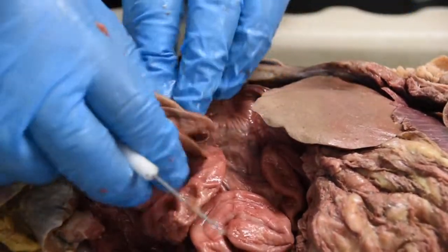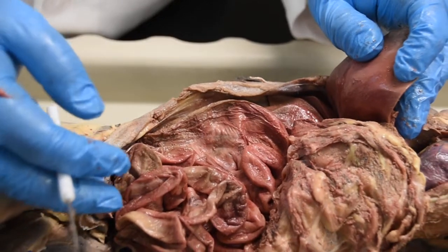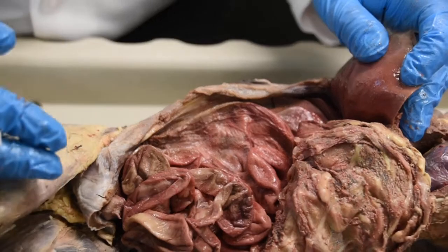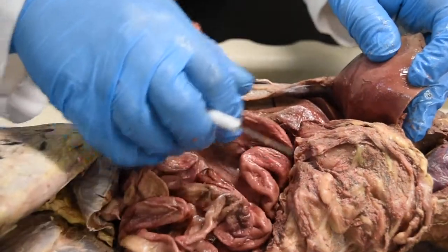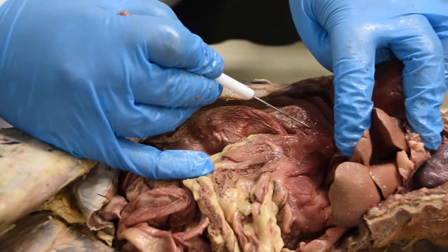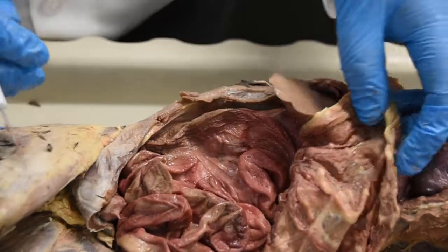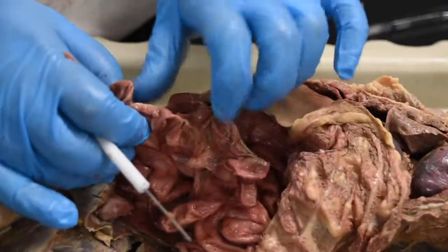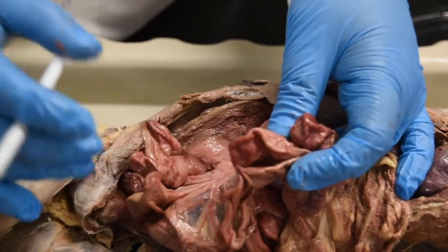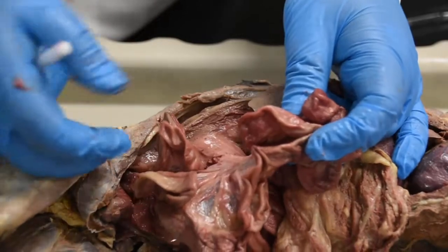I don't really need you guys to know immediately where the jejunum starts or ends and where the ileum starts and ends. What I do want you to know is the following. If you find the stomach and it's pointing right after the stomach, that would be your duodenum. If you see folds like this, closer to the duodenum, on the top, superior part, that would be your jejunum.